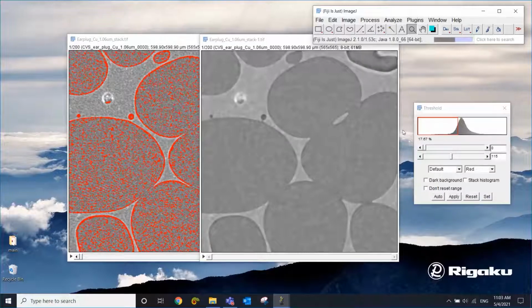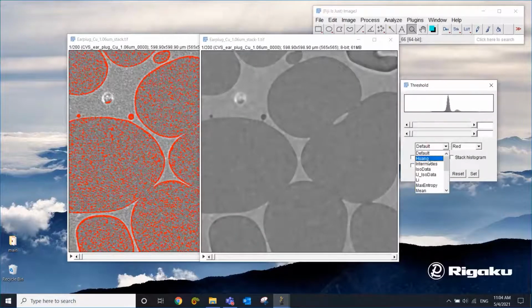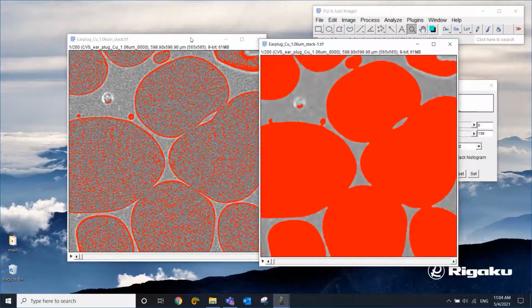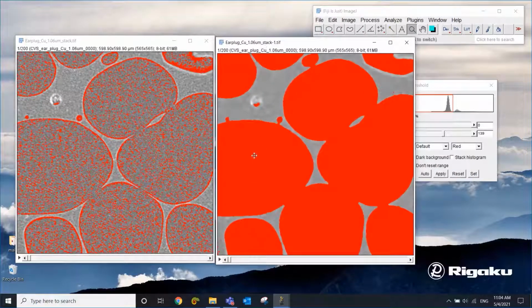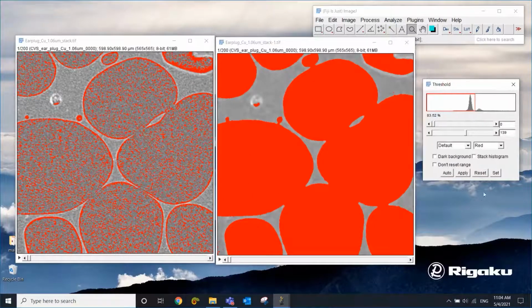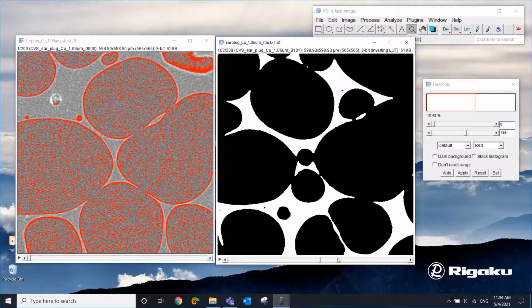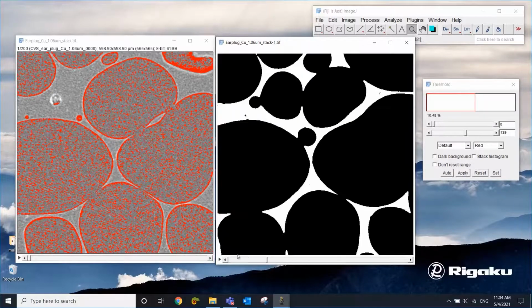So now ImageJ is applying the filter to all 200 slices. Now let's try segmentation. Okay, so you see that everything is kind of smooth, less noisy. And you can select different thresholding methods, but let's do default. You see how much cleaner this segmentation is compared to the original one? All the air parts are selected, the polymer is not selected, at least not much. And if you're happy with this, you can apply it. And now you have a binarized 3D image, and you can quantify those two phases.